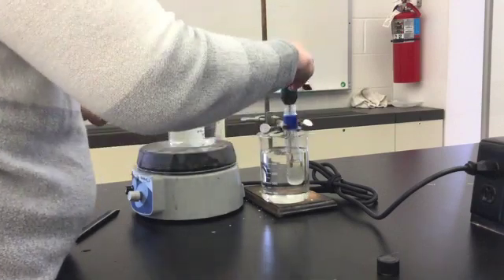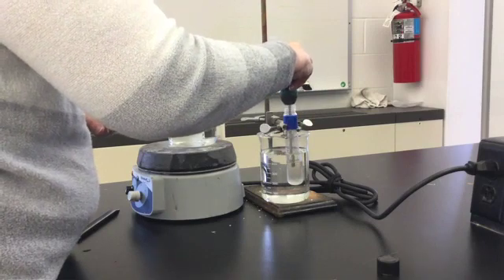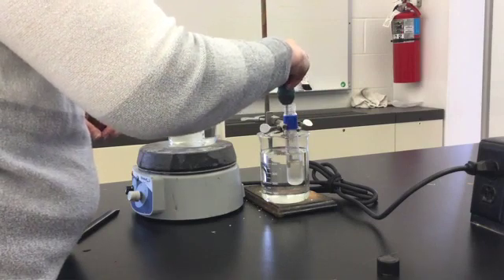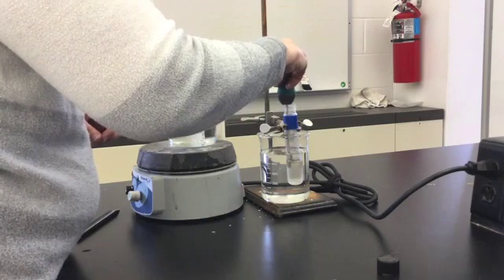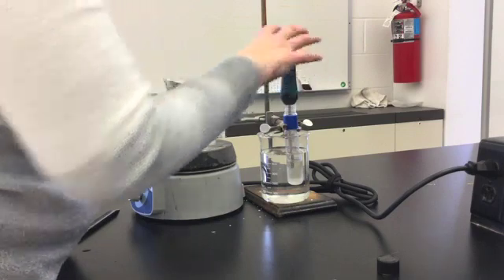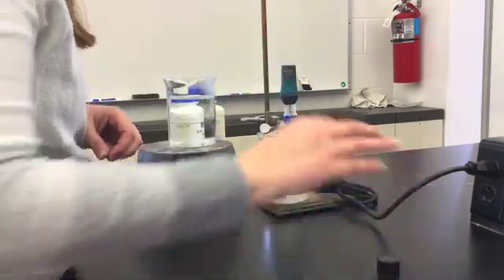This will help to cool the lauric acid more quickly. You can, with a slight up and down motion for a longer probe, or with a swirling motion for a shorter probe, begin to stir. Also, start collecting your data.